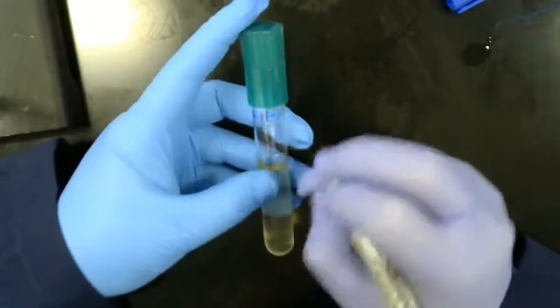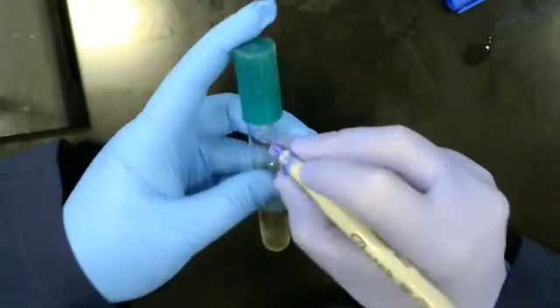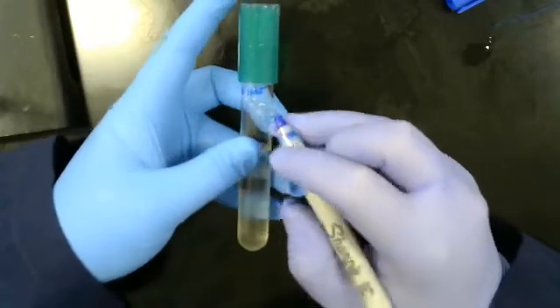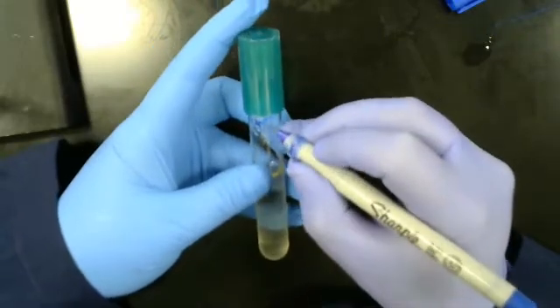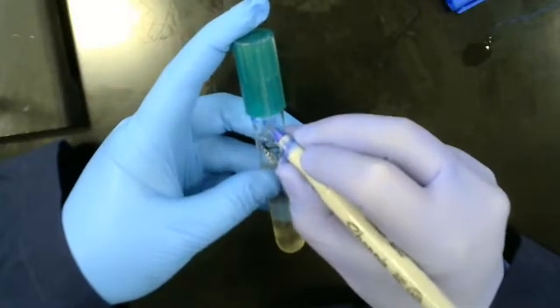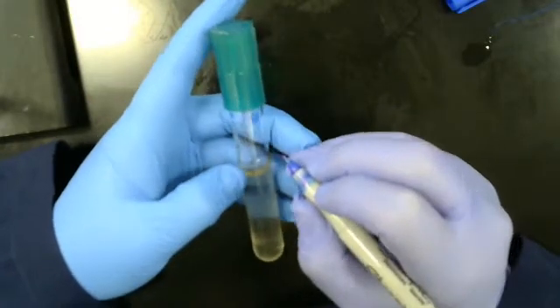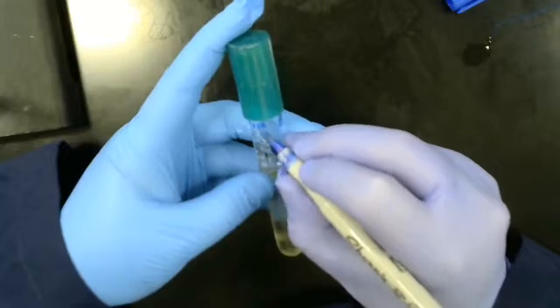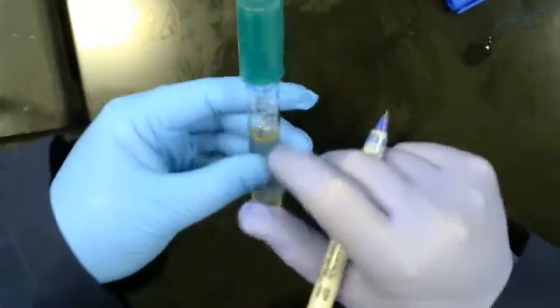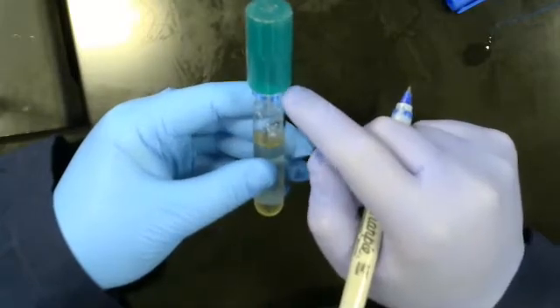Date. Media type. In this case, it's nutrient gel, so it's NG. Your initials. And then incubation temp. Notice how this, it's on the top of the lip, just under the cap.